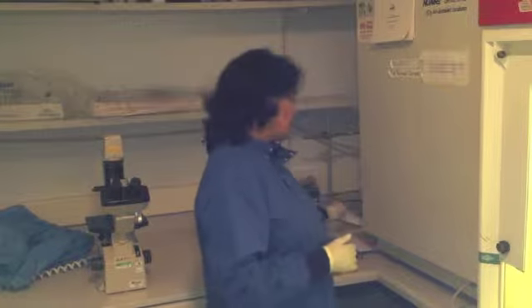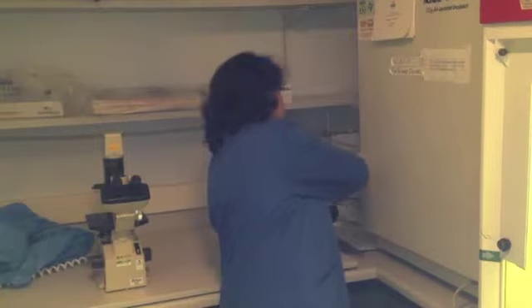Check to make sure that the MTT reduction has happened. After 20 to 30 minutes, I would recommend you check in the incubator.